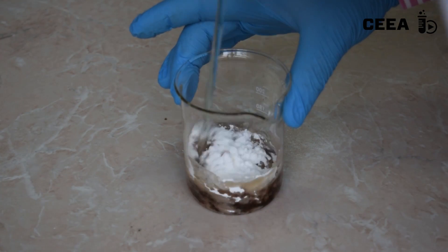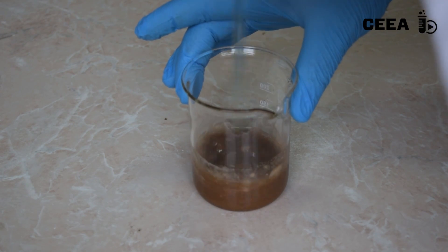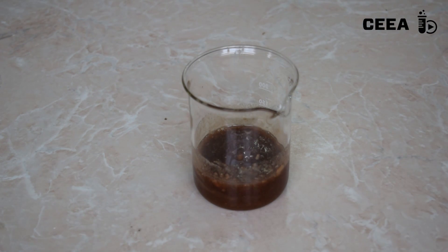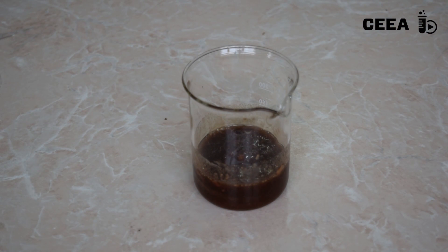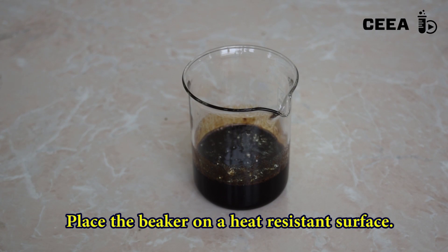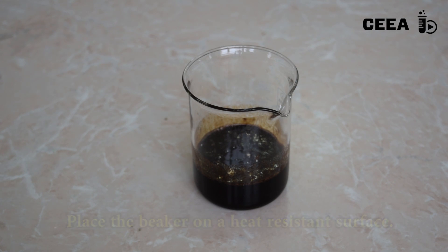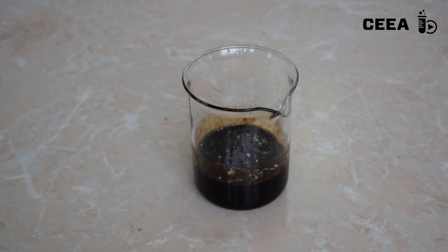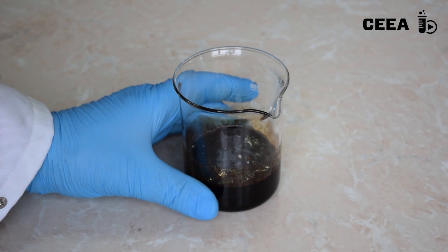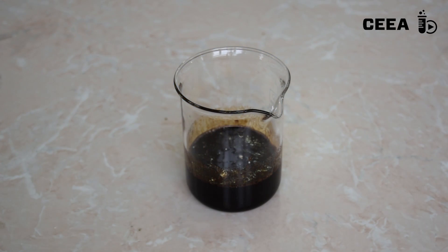Observe that initially the color is brown, but soon it will turn black. After a few minutes, steam is evolving and we can feel a burnt sugar smell.